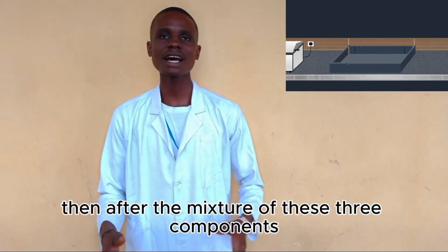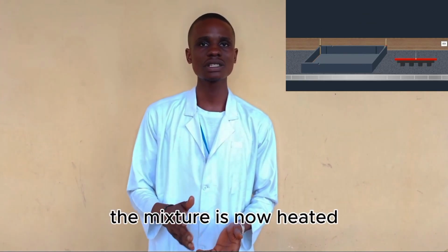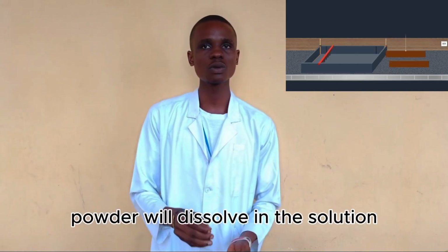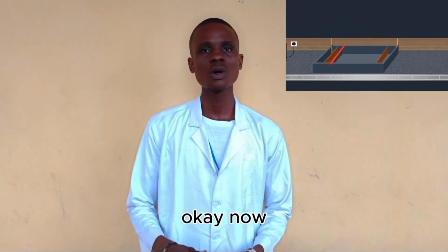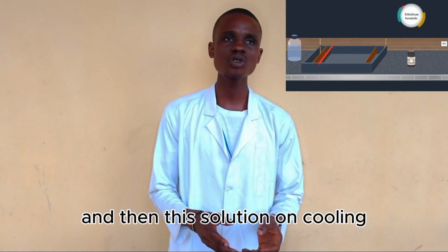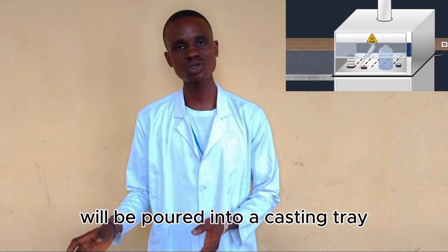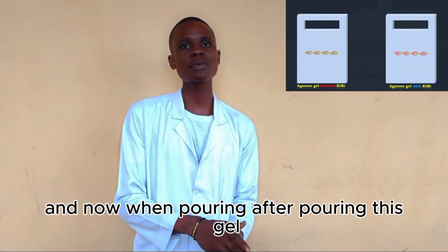Then after the mixture of these three components, the mixture is heated to a point below boiling point so that the agarose powder will dissolve in the solution to form a pure and clear solution. And then this solution on cooling will be poured into a casting tray fitted with a Teflon comb.